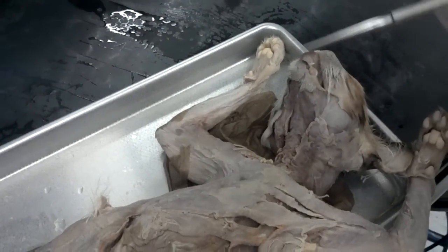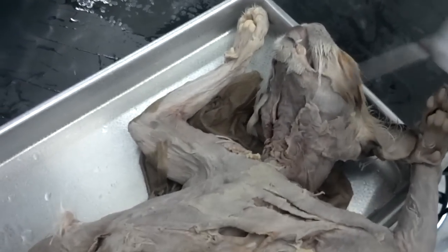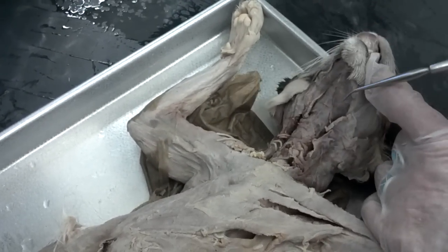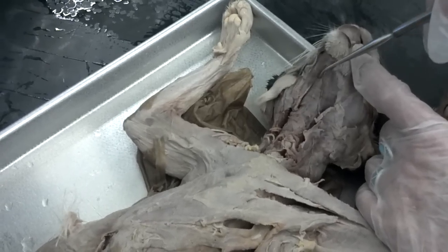Because the cat was euthanized in this area, the sternomastoid is totally messed up, but you have to know it's there anyway. Here is the digastric — you can see two bellies — digastric, underneath the mylohyoid.